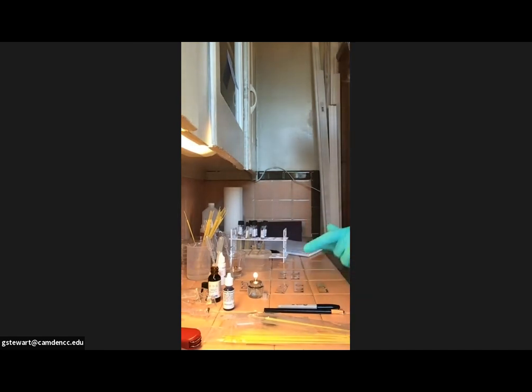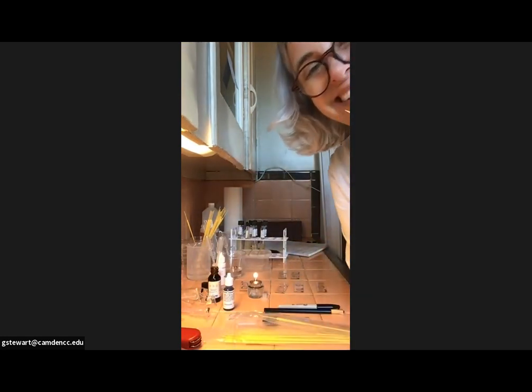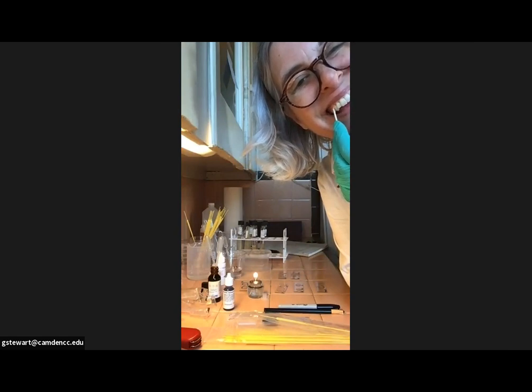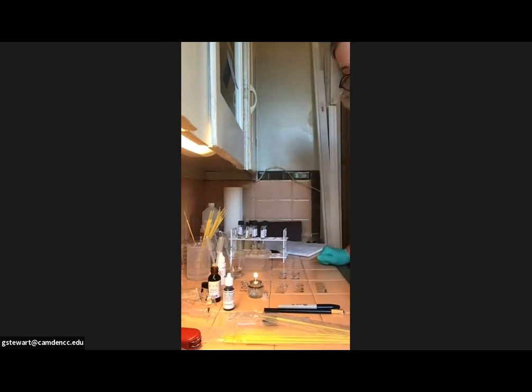And then I'm going to hit the whiteboard and I'm going to tell you in a minute how I loaded those. Oh, and we should do the toothpick one while we're here. So I did get a toothpick, and you want to, no blood, okay? So you want to just go kind of in these gingival cavities, kind of up here where your teeth meet your gums, like right there. And then you're going to smear that into the water. And we're going to see what kind of bacteria we have in our mouths. Now, technically, this is full of bacteria. You can just throw it in the trash. I am going to pop mine into the ethanol container.